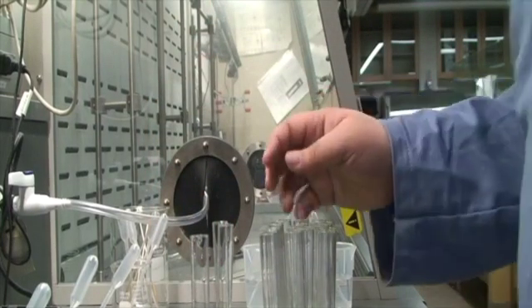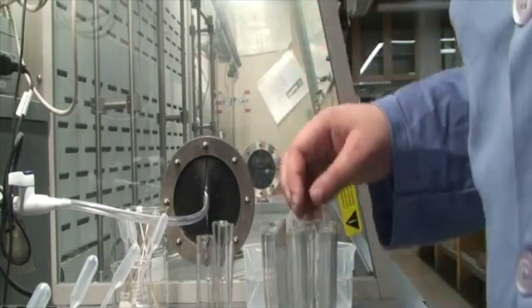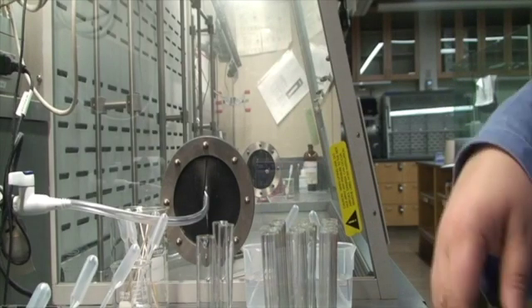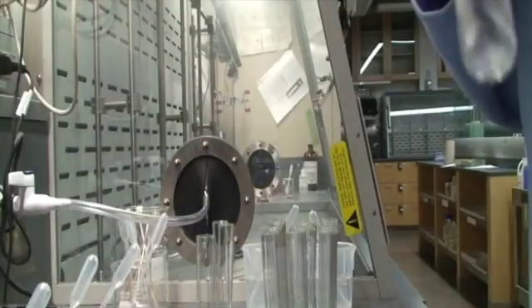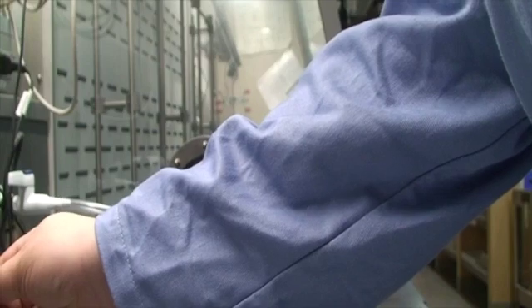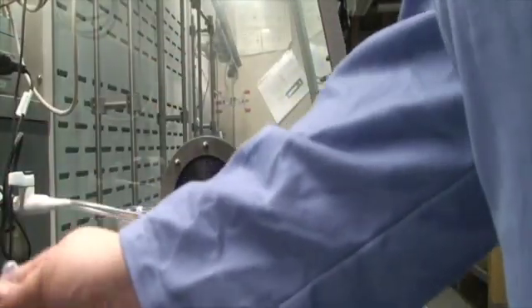Alright, so we're going to do 10 and 11 now. So here's 10, and 11.